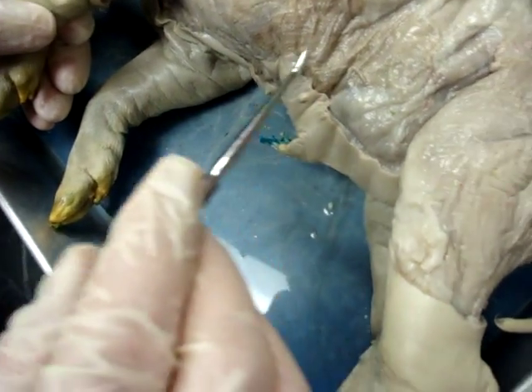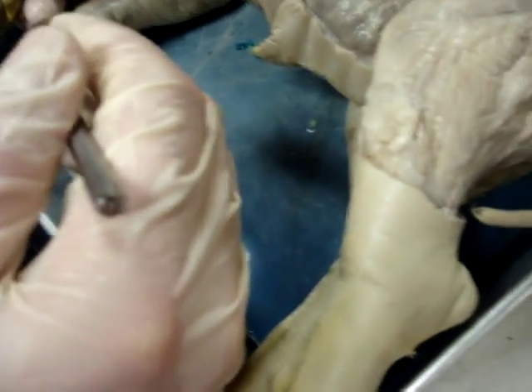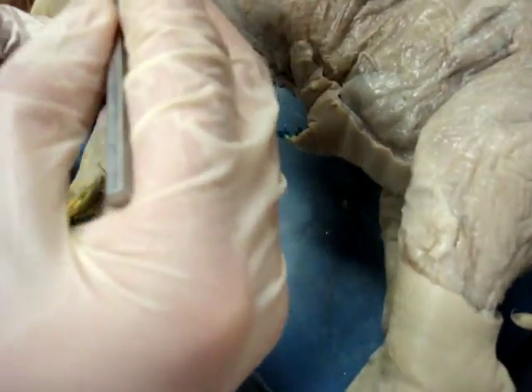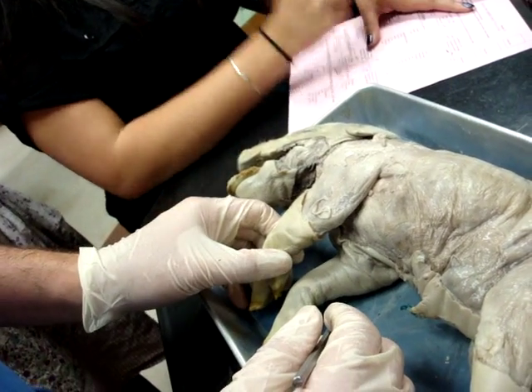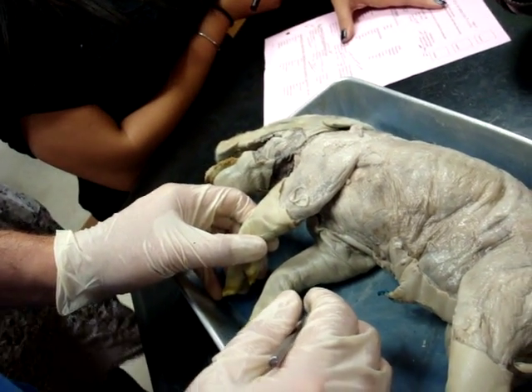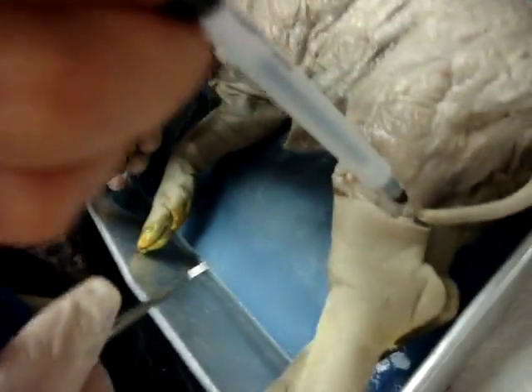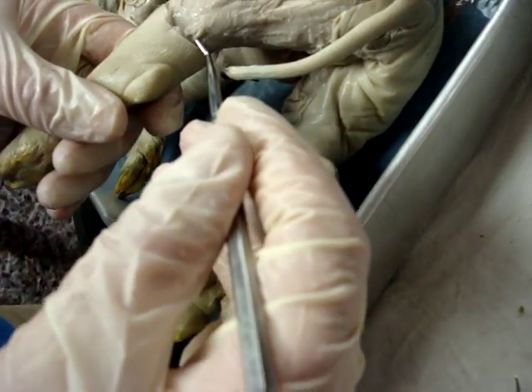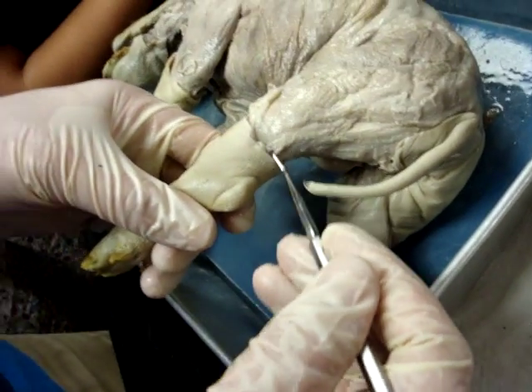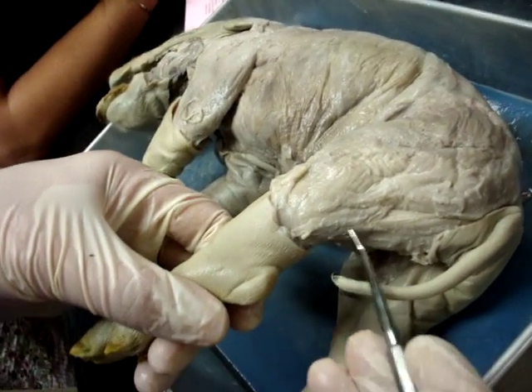What's the fascia? It's the tissue around the muscle that actually holds it in — not just this lining stuff here, it's actually around the muscle. Without it, you wouldn't be able to see the direction of the fibers; it would just be a smooth mass. Alright, gotcha. Where is your gastrocnemius? Above the heel. You have to cut further down — you have the tip of it right there. Basically like the calf above the heel. That's the gastrocnemius.